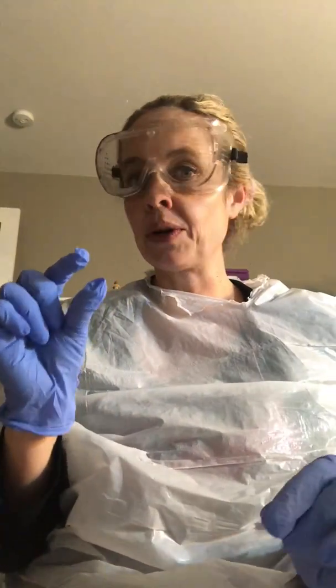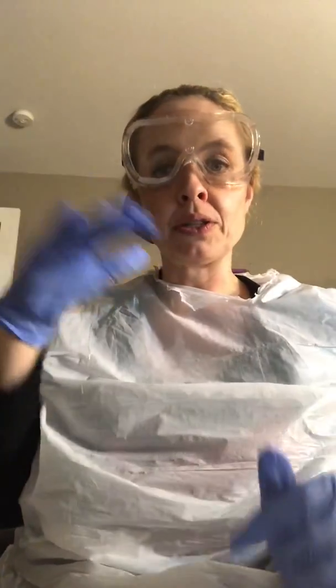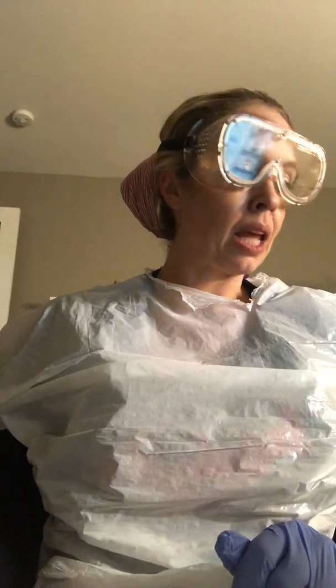But the E. coli was real obvious because it almost looked like when you have vegetable oil and then it doesn't blend with the water, so it kind of sits on top, but it was a little bit darker. That one, when I added the reagent B. So that is on those two.